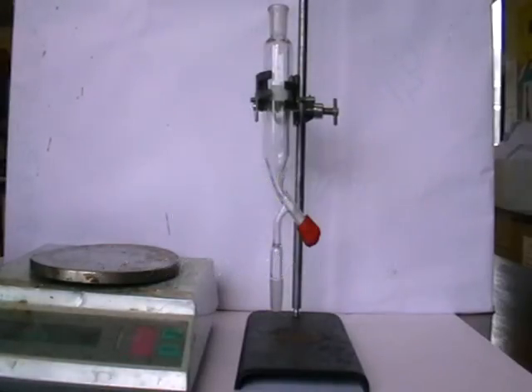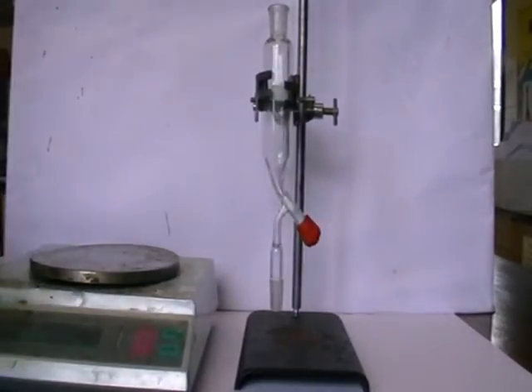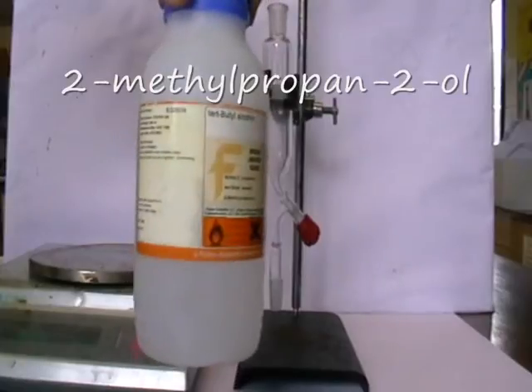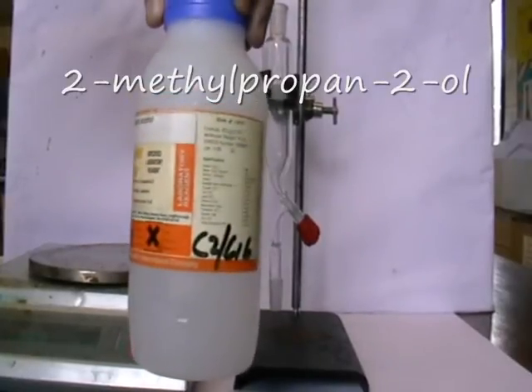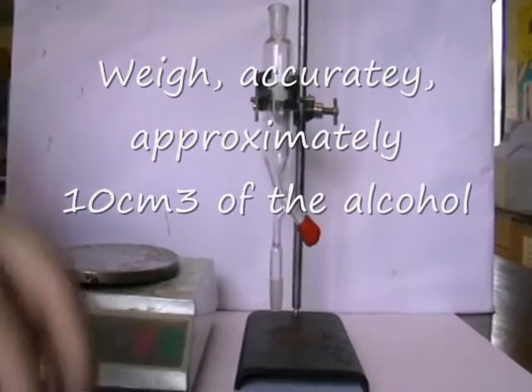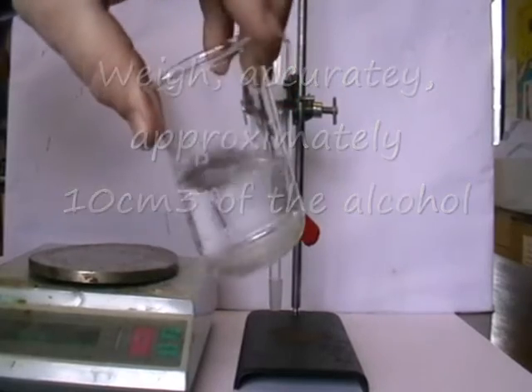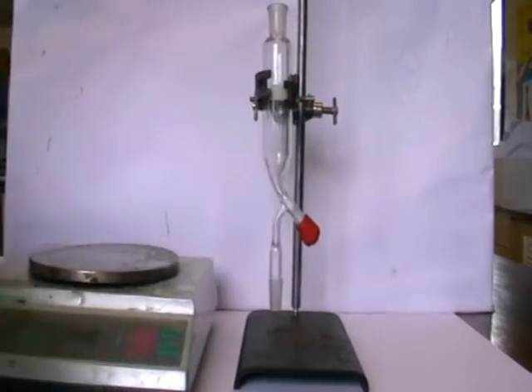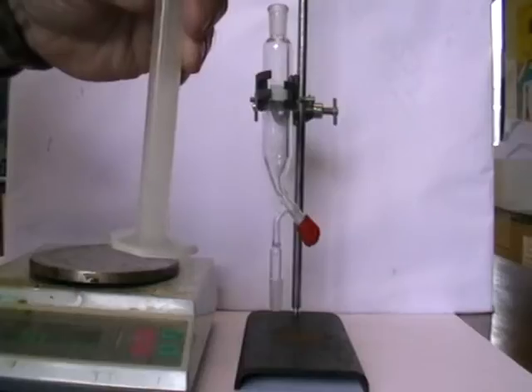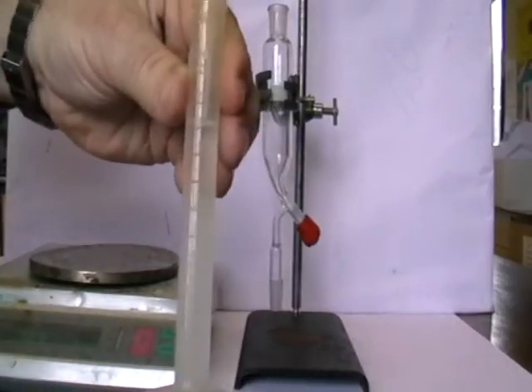The first instruction in this practical is to put in my alcohol — I'm going to measure it using a measuring cylinder. This is my alcohol, 2-methylpropan-2-ol, which is also known as tertiary butyl alcohol. I have a 10 cubic centimeter measuring cylinder here. This is my alcohol in a beaker — it's a colorless clear liquid. This alcohol tends to solidify at room temperature, so I placed the bottle in some warm water for a little while. I pour out about 9 cubic centimeters — I say about, because we're actually going to measure its mass accurately — so there's about 9 cubic centimeters measured out.